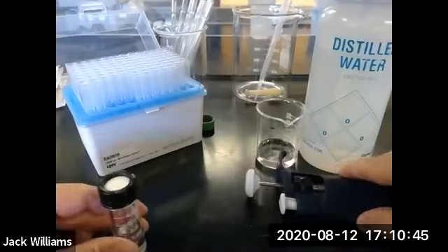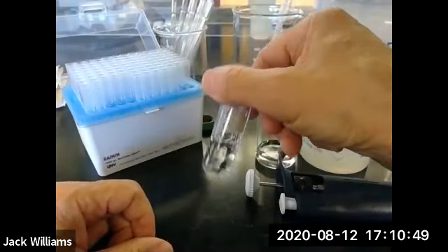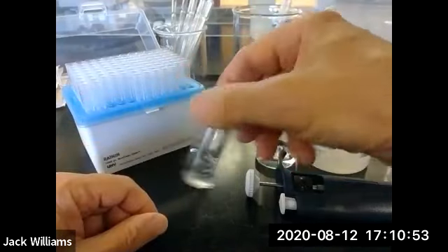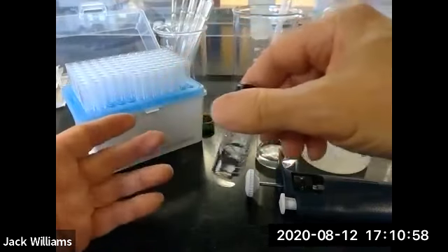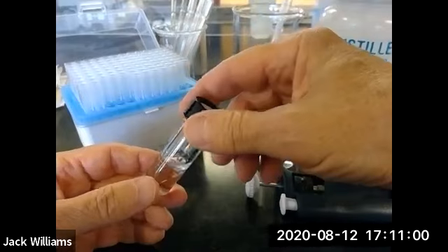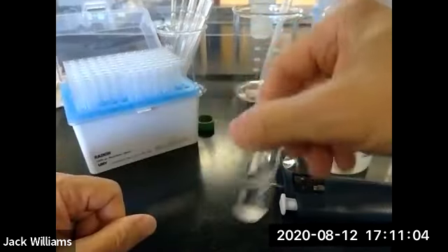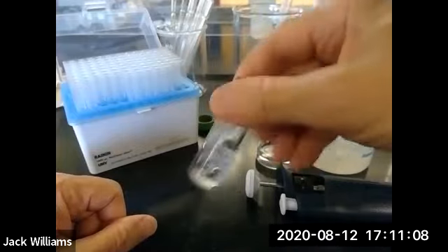It's okay. All right, so we've got 2 layers in there. Top is water. Well, I told you the answer. I'm going to ask you, which is the top layer and which is the bottom? Well, how would you find out? Well, you look up the densities, right? That's why you have a table. And in that table will be shown the densities of the liquids that you're using. So in this case, methylene dichloride has a larger density than water.